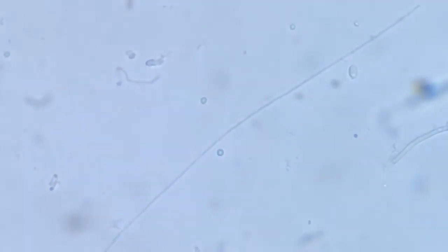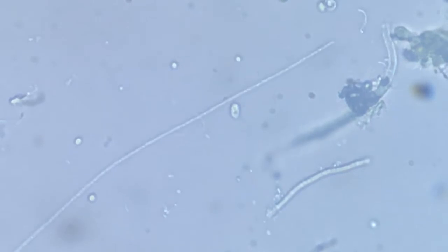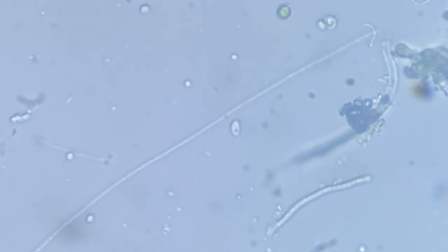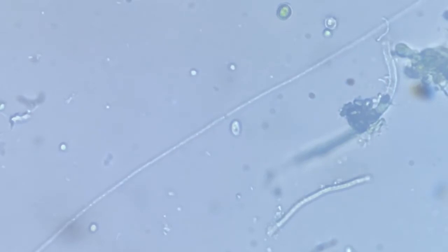Okay, so this is one of those general samples. Now probably you'll be able to make a more appreciable arrangement. Probably you can make out that streaming movement within the body, a kind of a streaming of either food particles or body organelles, or maybe the eggs. It's happening within the organism, and it's constantly moving. It's on a constant movement.